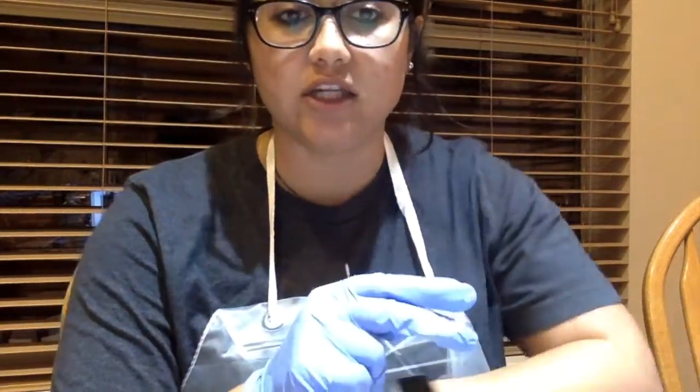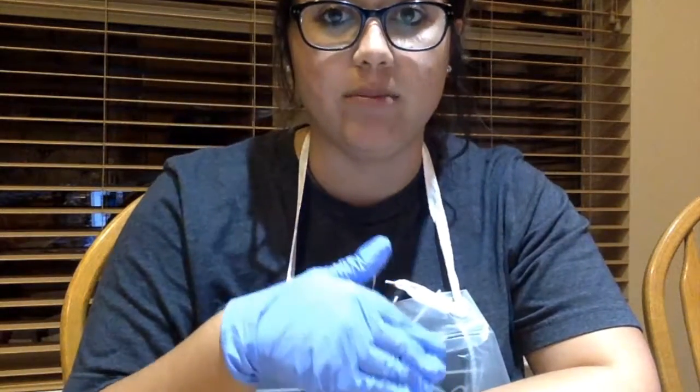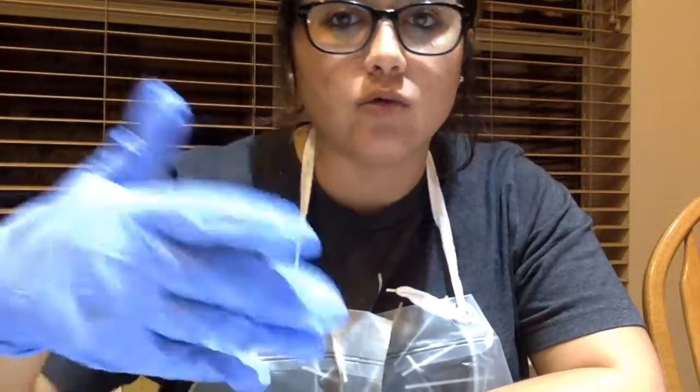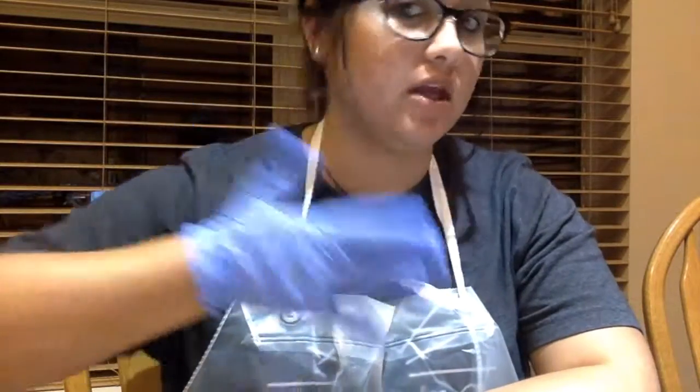And then on the next two parts, I will do the same preparation, but instead of only adding 0.5 grams per liter of ascorbic acid, I will add 1.5 and then 2. So that may change the amount. I don't know. I'm about to see, but once I conclude that, that will be the end of activity 1.